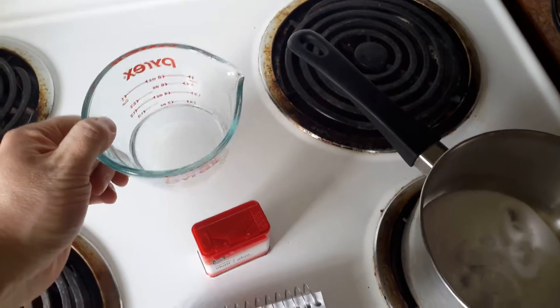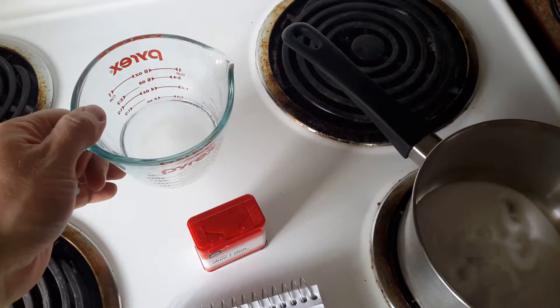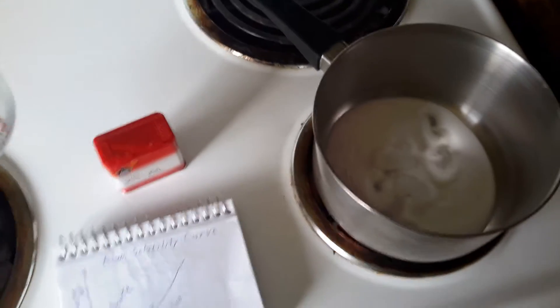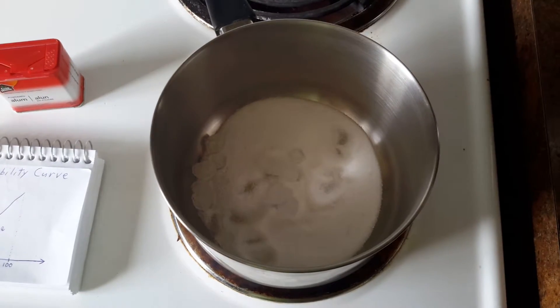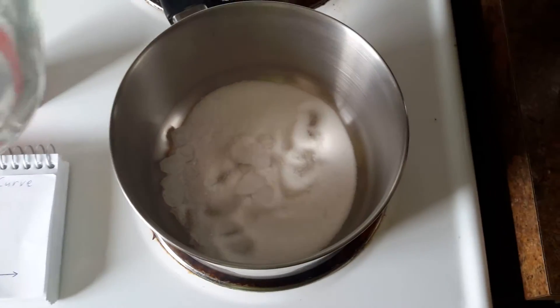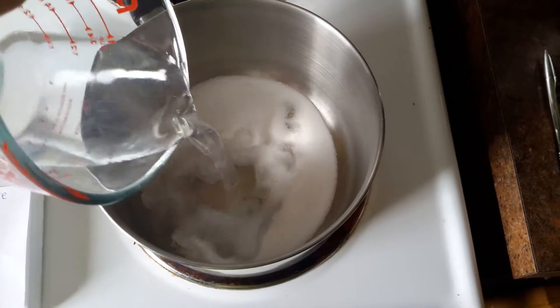It's one gram per milliliter, so it's very easy to measure out the amount of water that I need without having a scale of the precision that I would need to do this well.